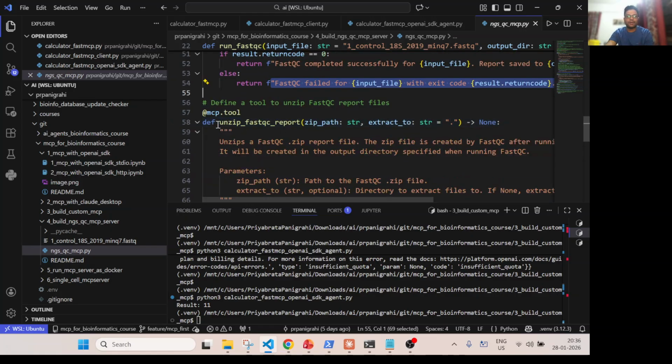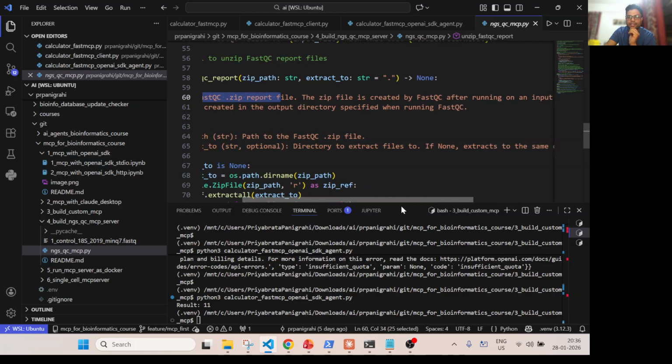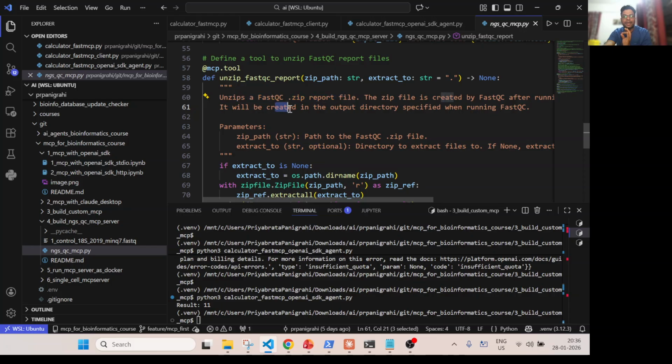So now the second step is unzipping. Here the instruction is very important. I'm saying to unzip a FastQC zip file. The zip file is created by FastQC in the first step, after running on the input fastq file. It will be created in the output directory specified when running FastQC. I'm telling the agent that because it will not know where this file will be present. So I'm giving the instruction that this will mostly be present in the output directory given by the user.